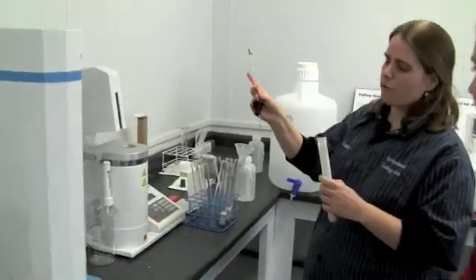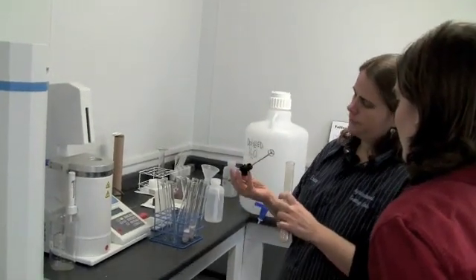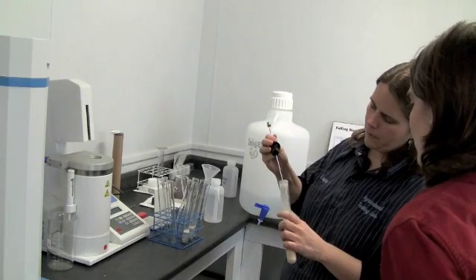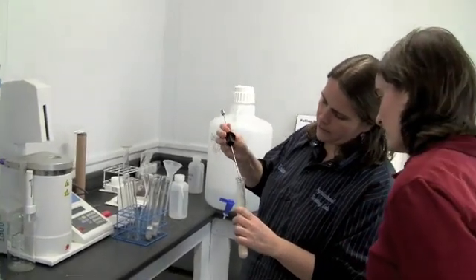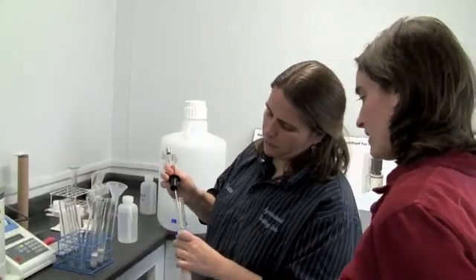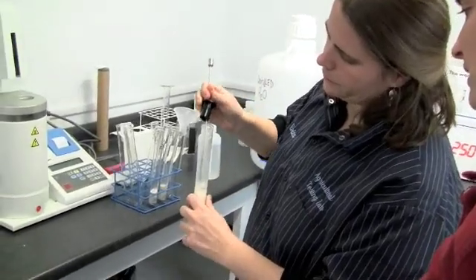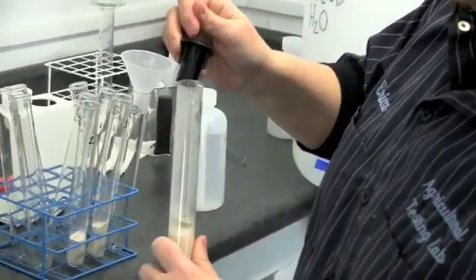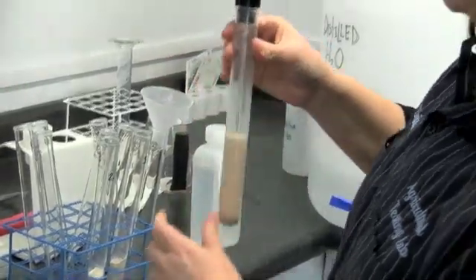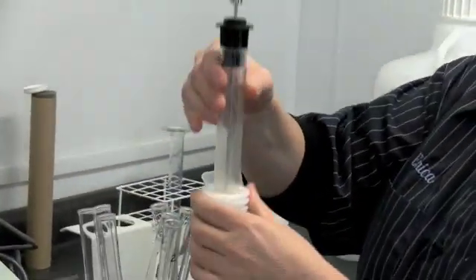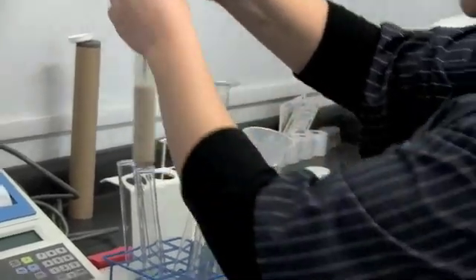Then you're going to shake it up until you get basically everything into solution. This is the little apparatus, the little plunger. You're going to put this on the top and scrape down the sides. You want to try to get as much as possible actually into the test tube, then add this little sleeve like so.